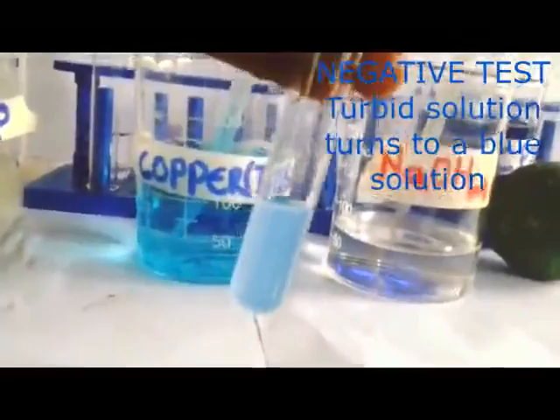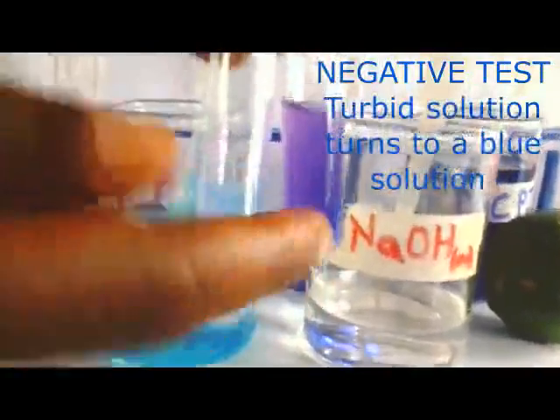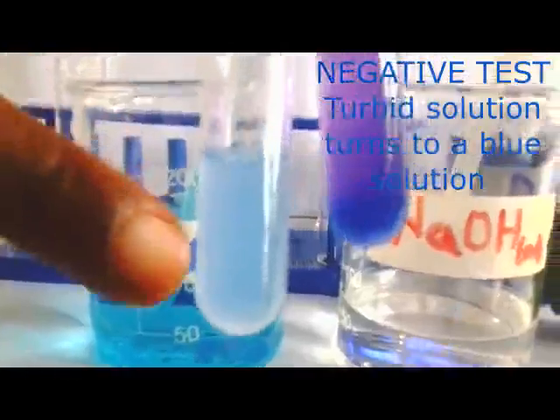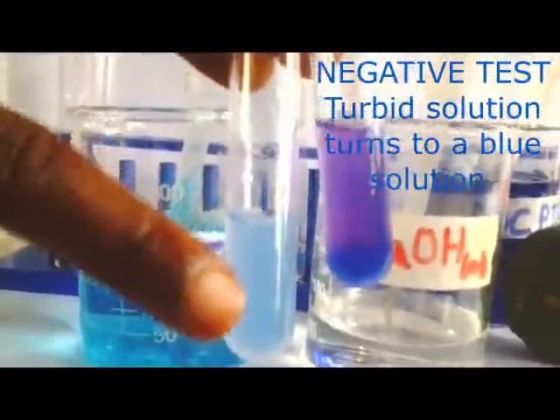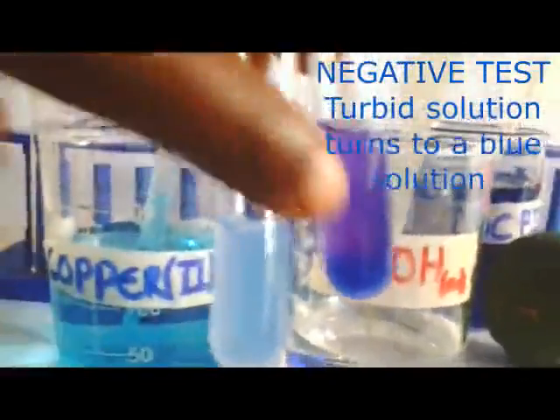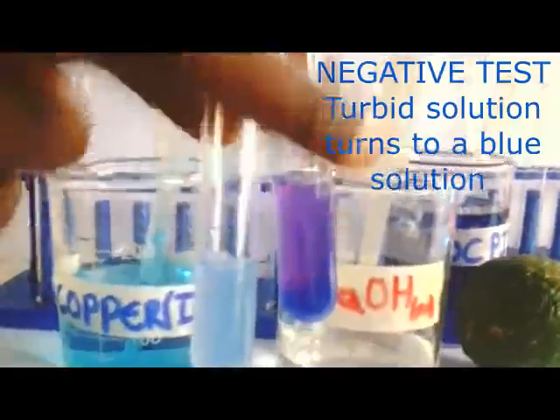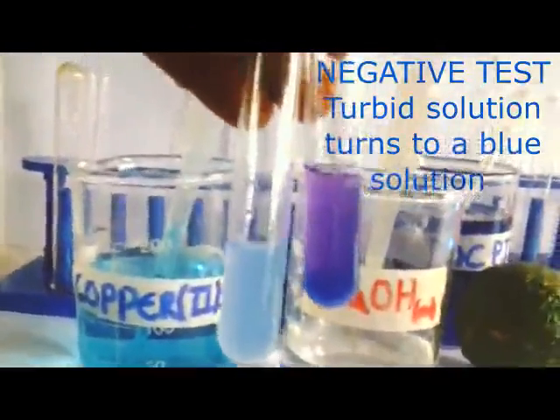When we use the solution P, our results were like this. When you added the sodium hydroxide and the copper 2 sulfate, you get a purple or violet solution. When we used our starch solution, which we confirmed already, the solution is mainly blue. This is blue, but this is violet. This one we say proteins absent. Here we say proteins present. That is after adding sodium hydroxide as well as copper 2 sulfate.